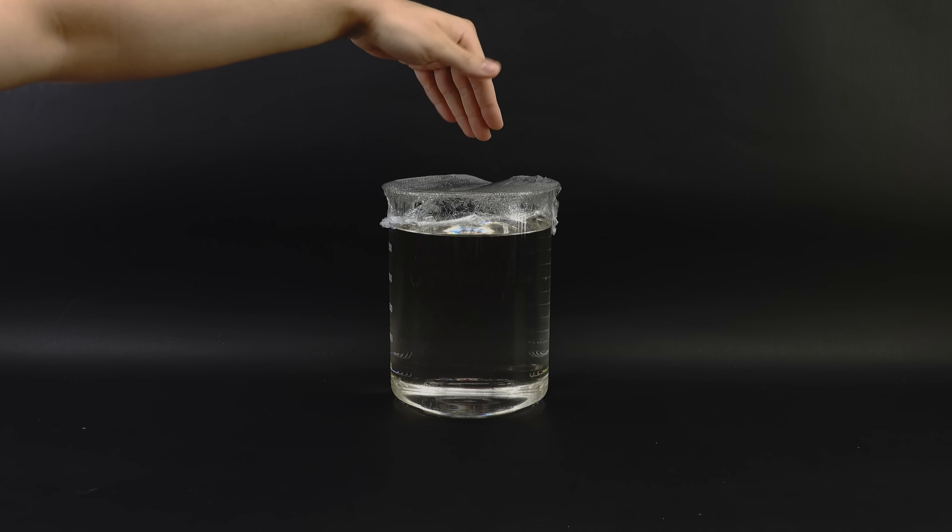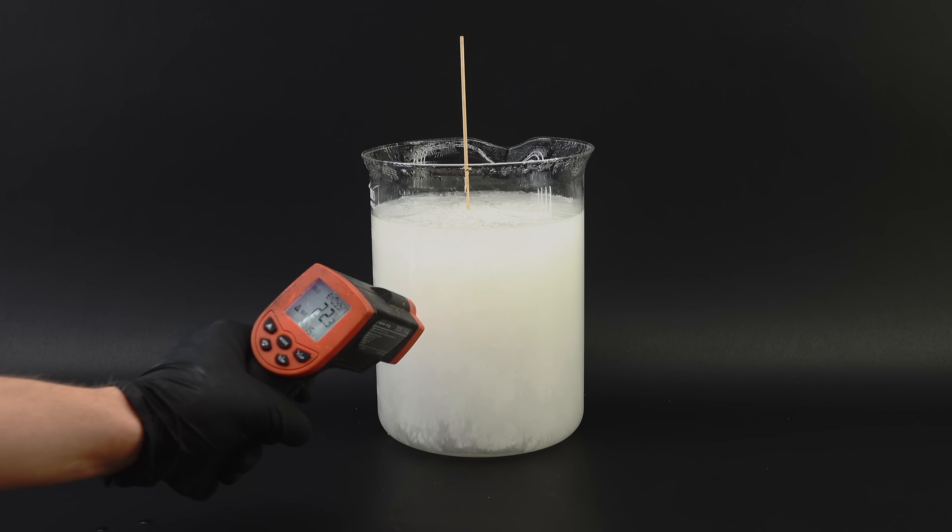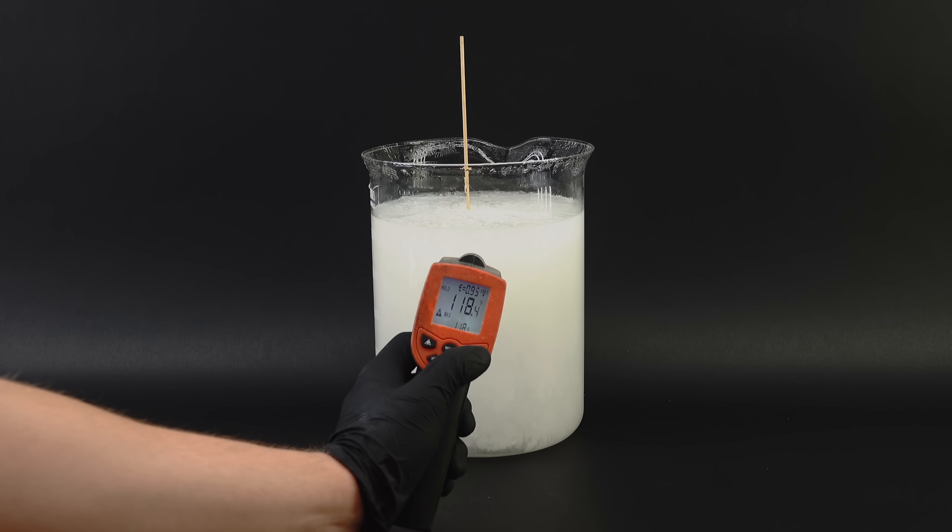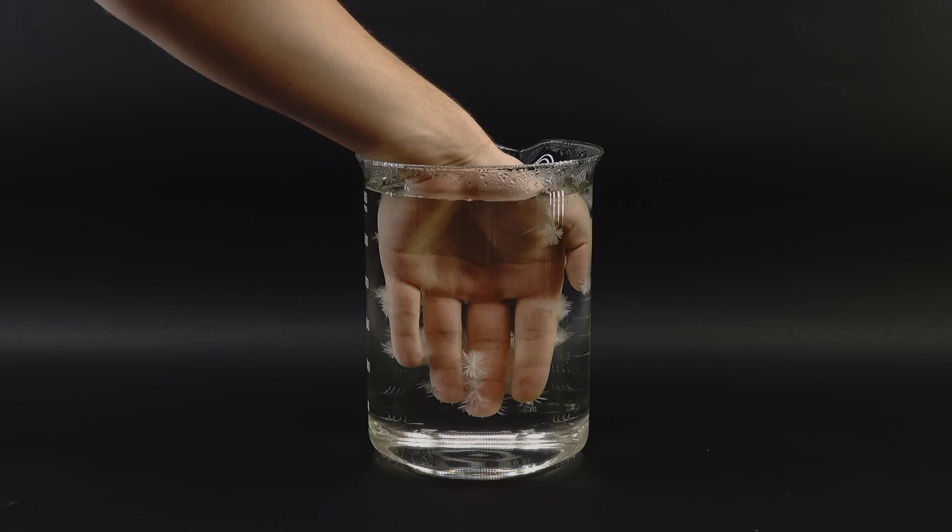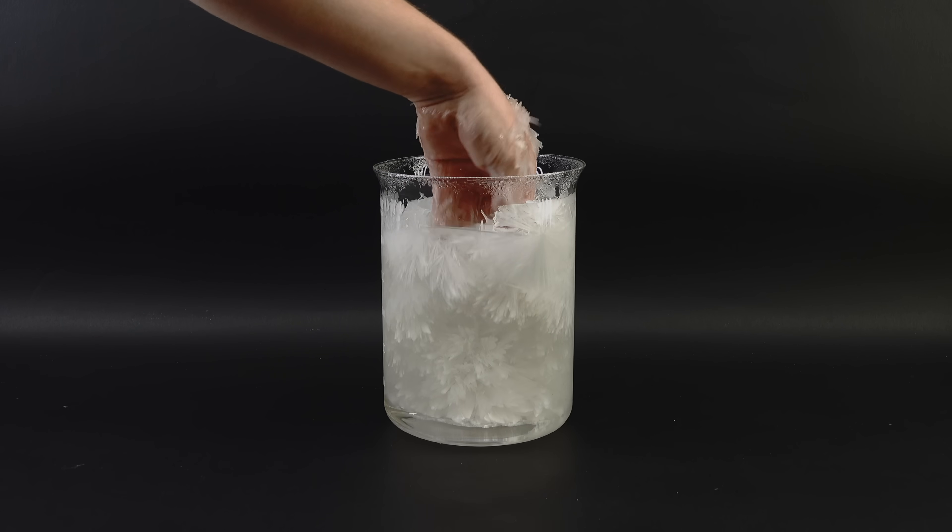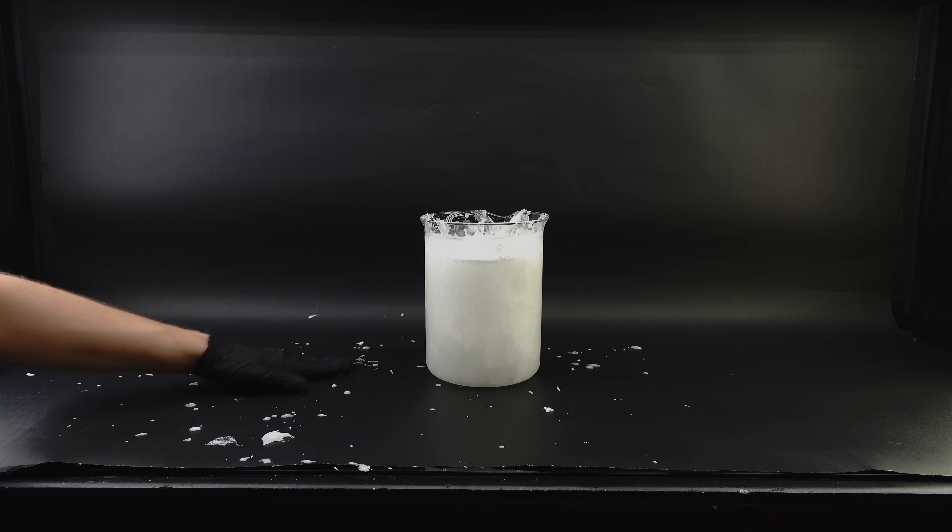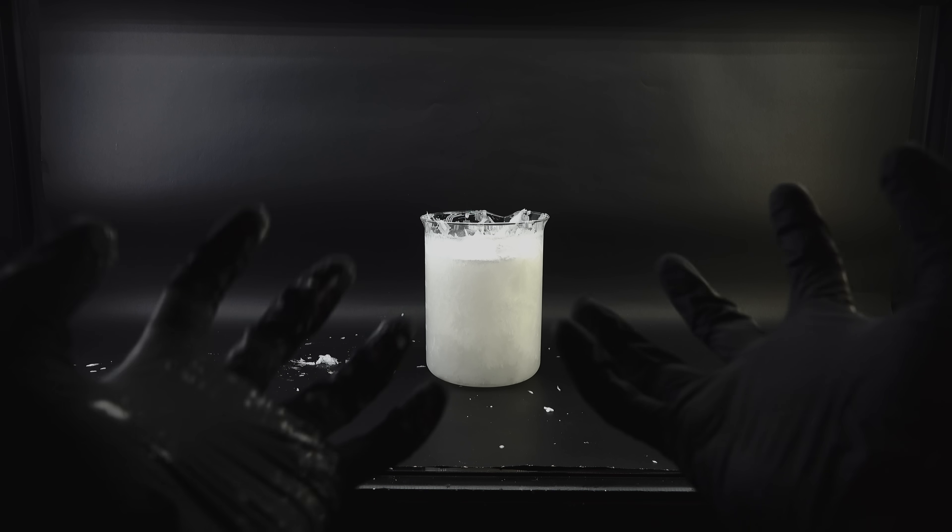The tiny issue with this, however, is that sodium acetate heats up big time when it solidifies, and cooking my hand with it isn't really optimal. Nonetheless, many people seem to have done this on YouTube without much trouble, so I figured it's alright. Well, it wasn't nearly as alright as I'd like, with my hand getting quite severely burned and hot sodium acetate spraying everywhere, which leads me to believe that other YouTubers who did that are cyborgs or something.